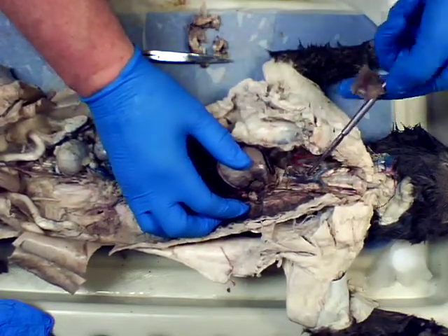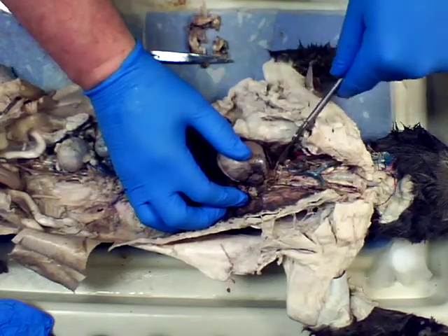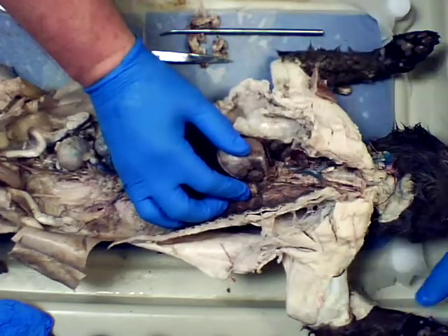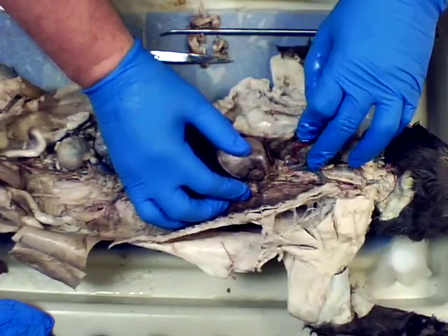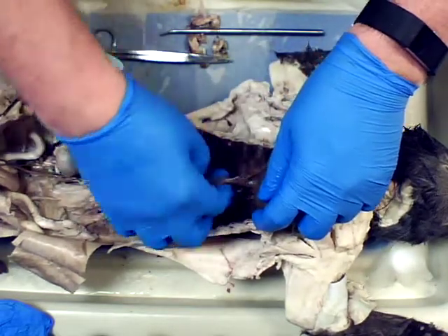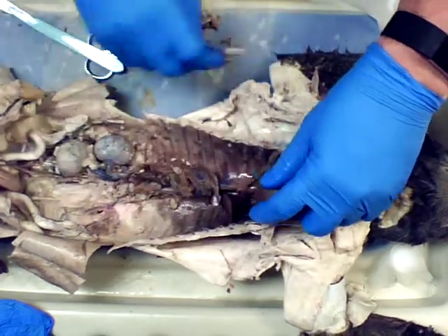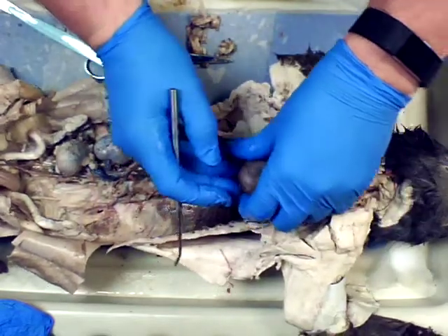This is the cat's cranial. What we would have is our superior vena cava that's going to come into the right side of the cat. So this is the right side of the cat, and I'm going to keep it straight. Okay, this is the left side of the cat. So for the cat, all that deoxygenated blood from the upper portion of the body, and all that deoxygenated blood from what is the caudal vena cava, what we would call our inferior, is going to go up into here, and that will all go into the right atrium of the cat.